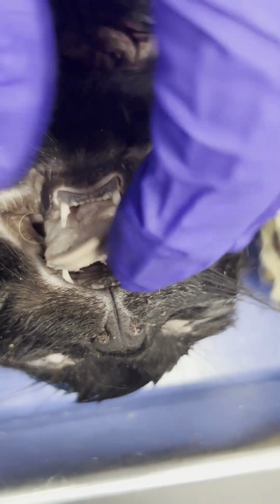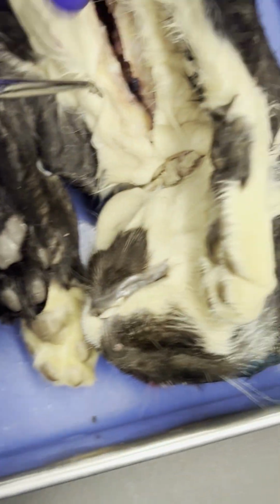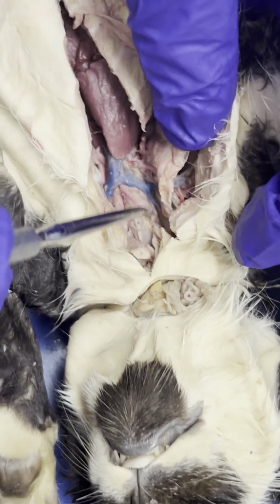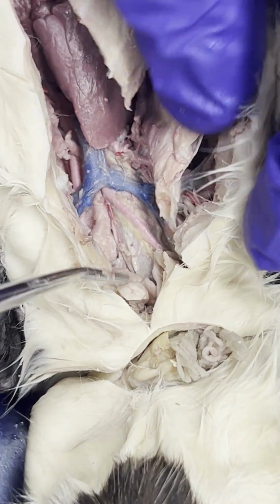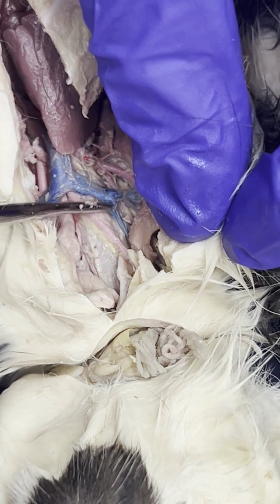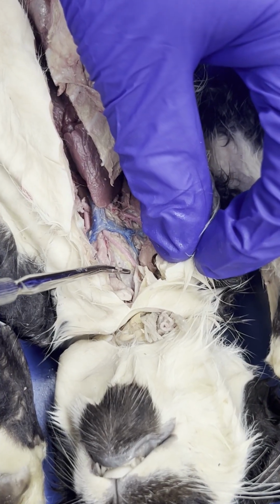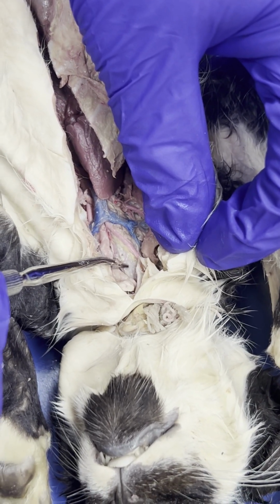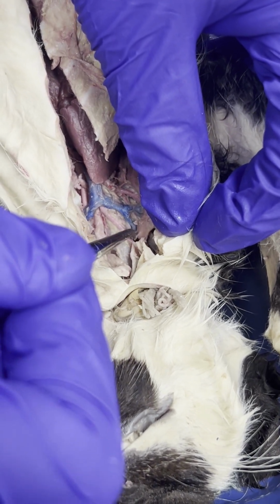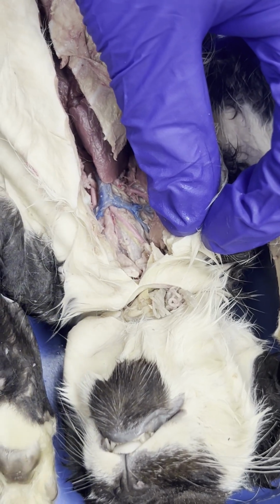And then last but not least, at least in this video, is the esophagus. So let's hop over to our other cat right here. Our other cat, I don't want to ruin it too much because we have some nice circulatory structures right here. But this structure right here is actually the trachea. Trachea, hopefully you guys know what that function is, but behind the trachea, or more specifically dorsal to the trachea, is the esophagus. So dorsal to this, or right behind this, is going to be the esophagus. All right.